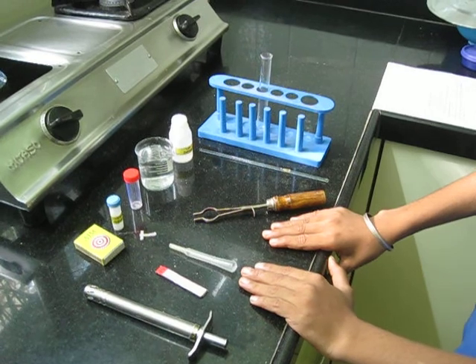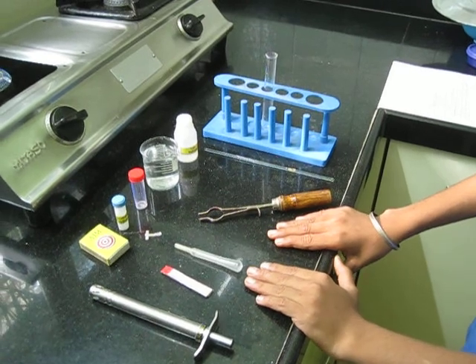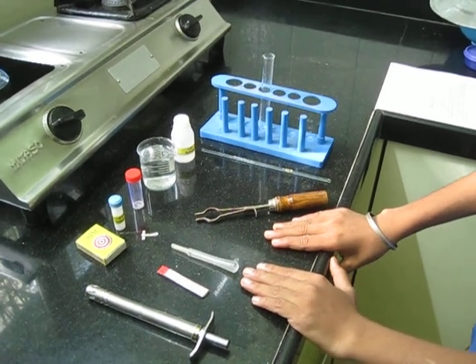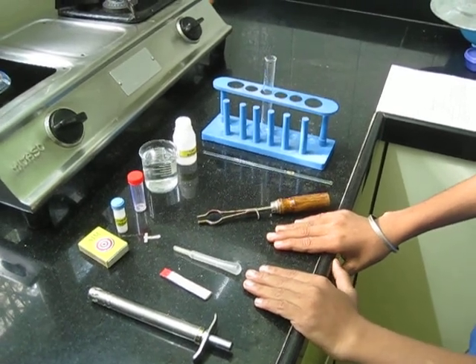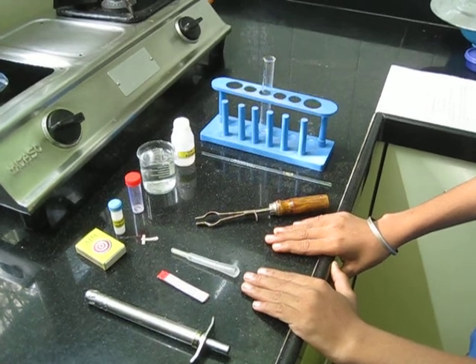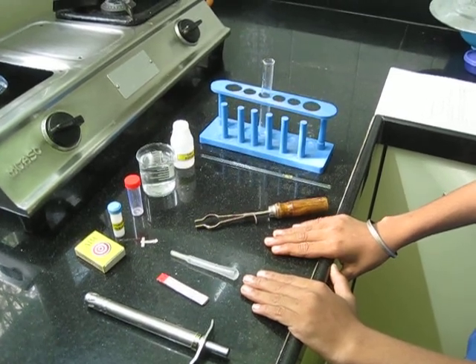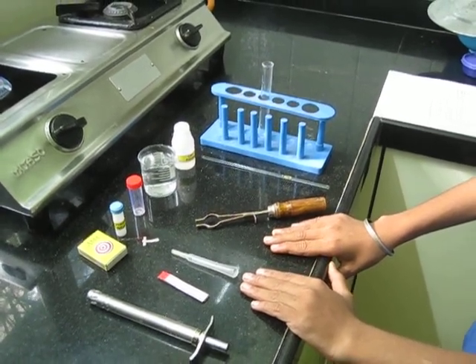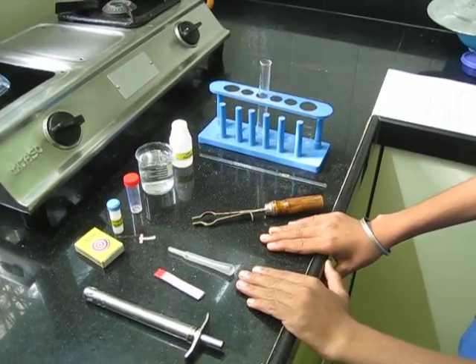Today we will learn about a metal oxide, MgO or magnesium oxide. Magnesium forms an oxide by burning or fast oxidation.